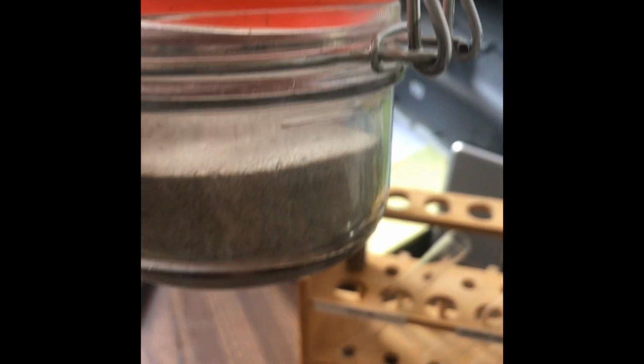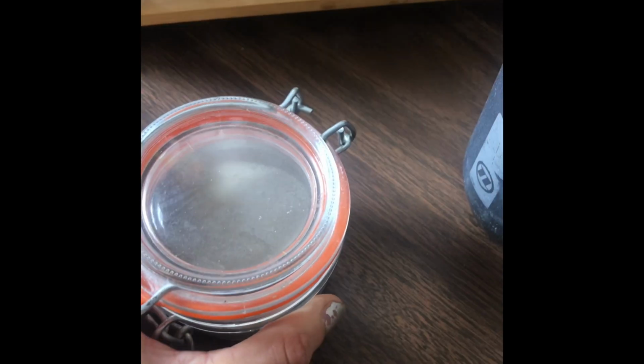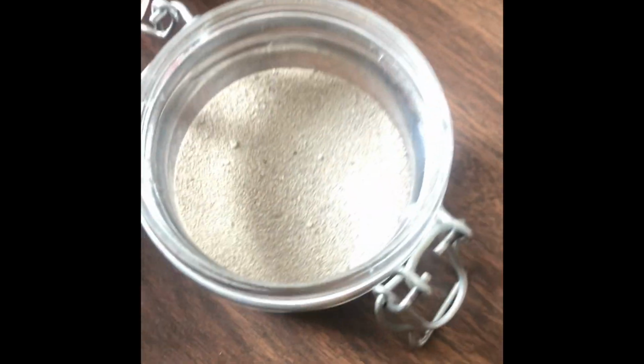Any more evidence for what this is? Getting closer. I want to compare. This is some sand that I took from the Great Salt Lake about, actually 2 years ago when I went out to the Spiral Jetty. So this has been with me for quite a while. So let's take a look at just what this sand looks like and compare it to this that I found in the water.